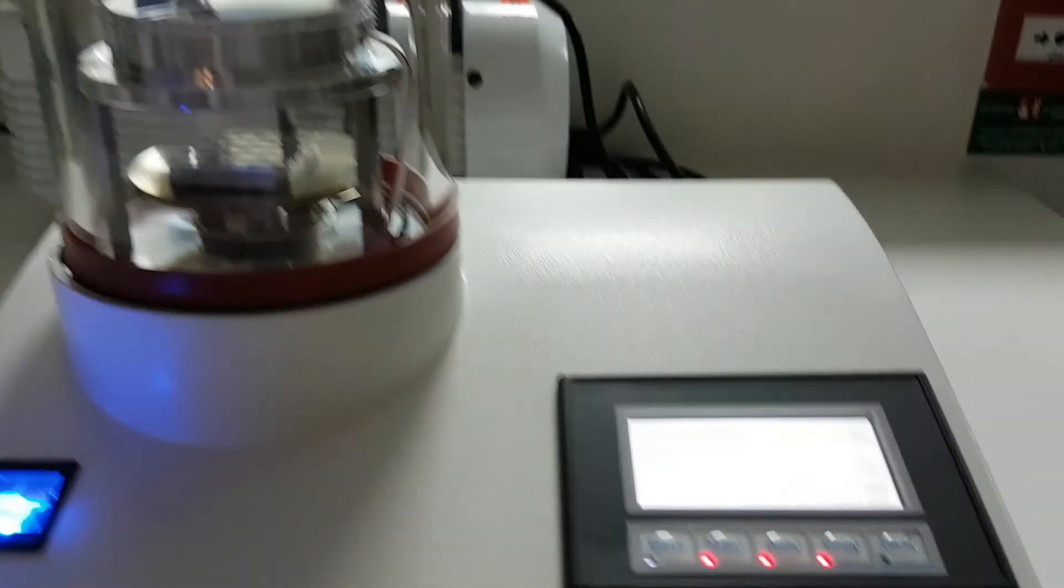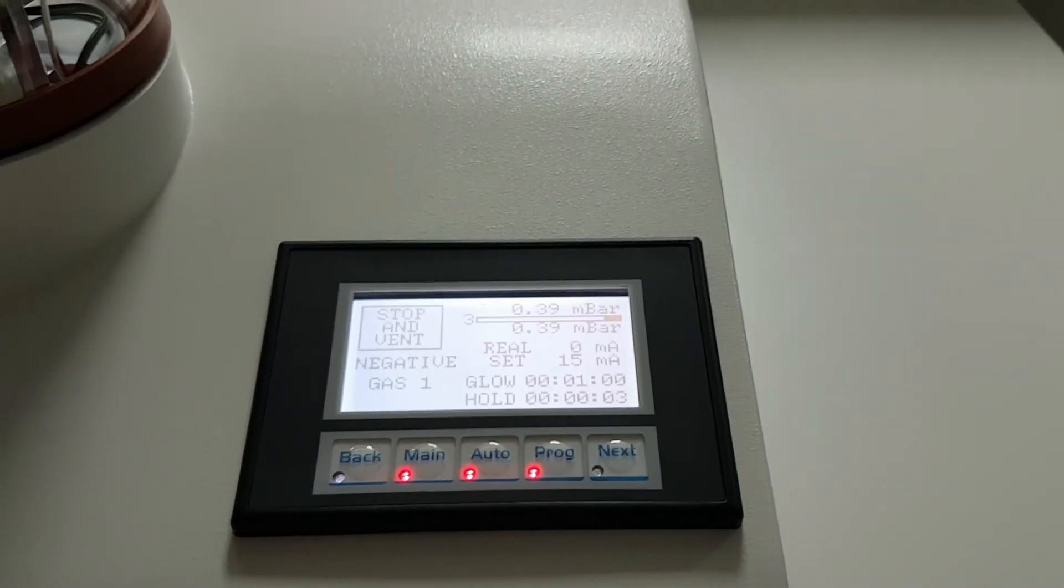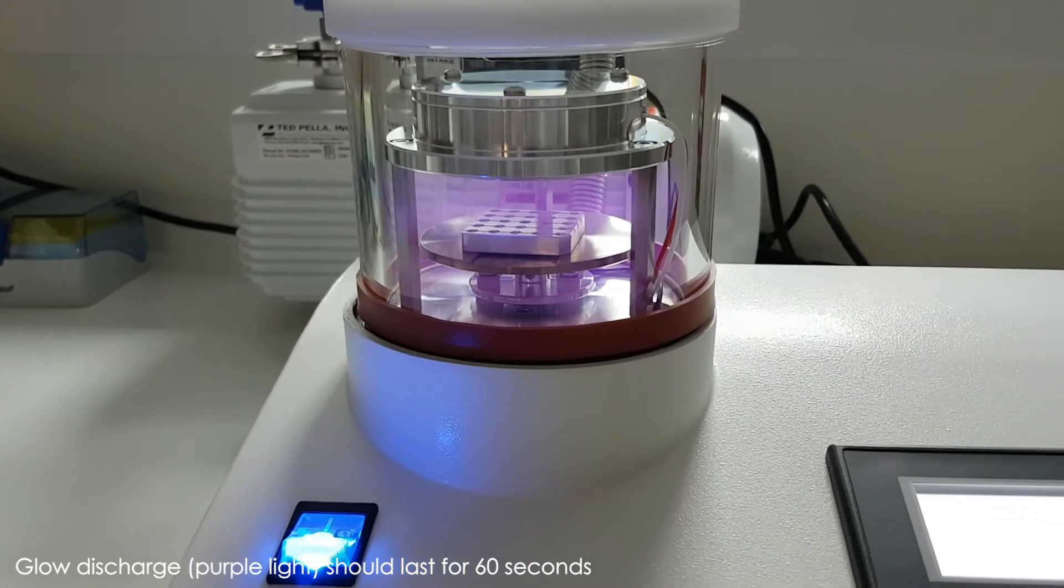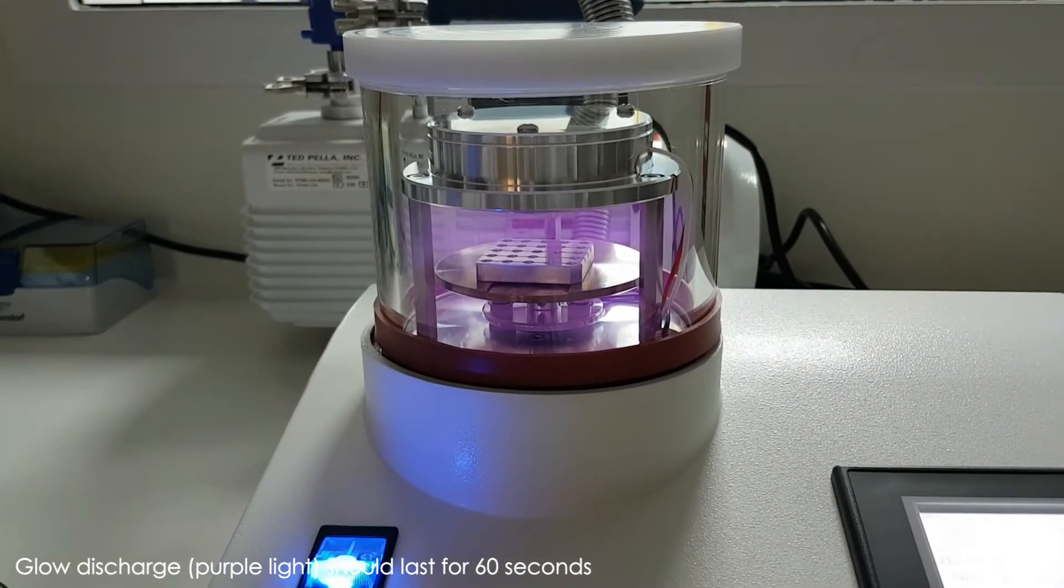The pump will make a loud noise. When the chamber pressure is achieved, a purple light should be visible inside the chamber.